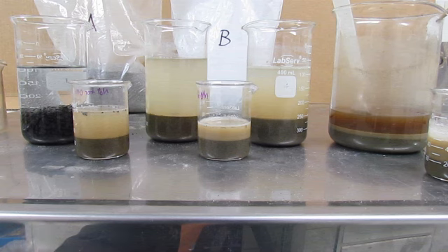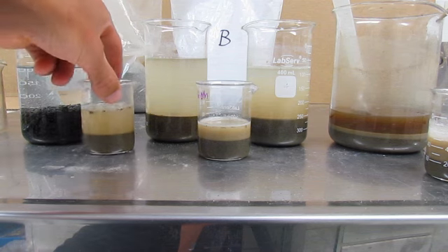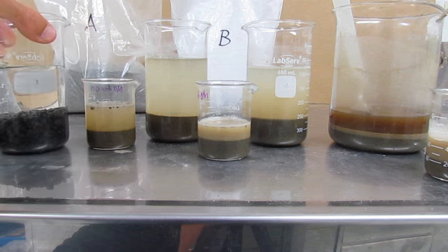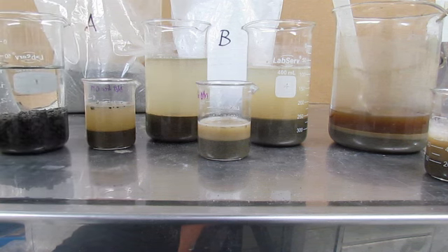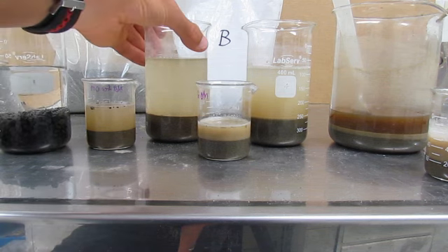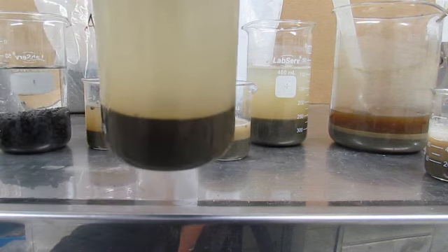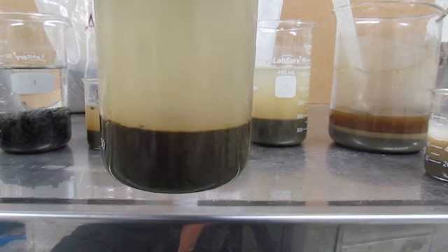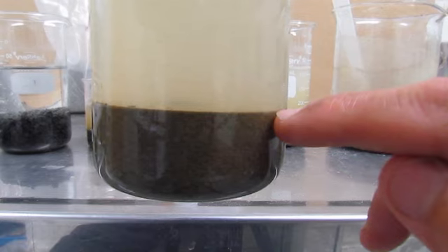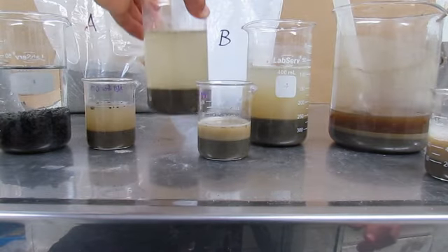The second part of this is that over time the material will tend to settle out, and these bigger containers at the back here have been allowed to settle overnight. They will show us whether there's actually a layer forming on the surface. That one's got a very minute layer just in here, probably only 0.5 millimeter thick.